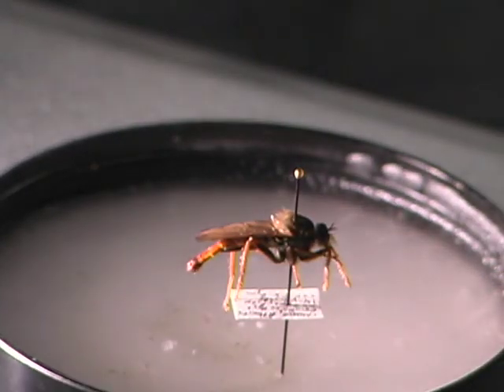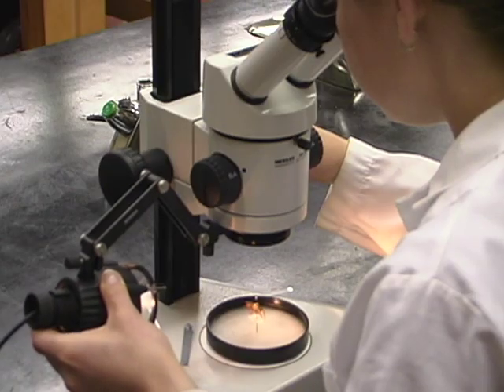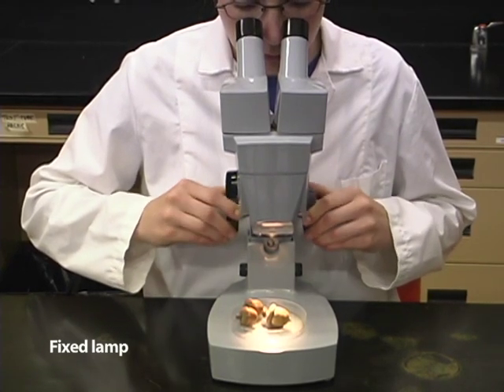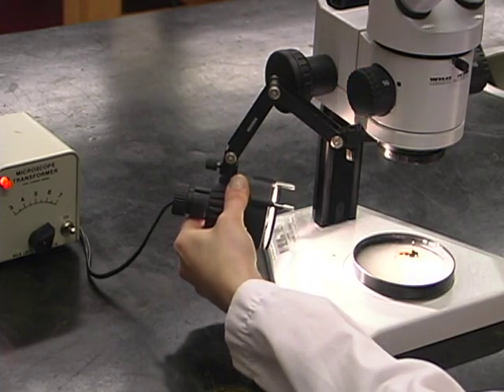The goal of lighting for microscope work is to obtain bright and even illumination across the entire field of view. In some microscopes, the intensity and position of the microscope lamp is fixed. In others, the lamp can be adjusted in various ways.